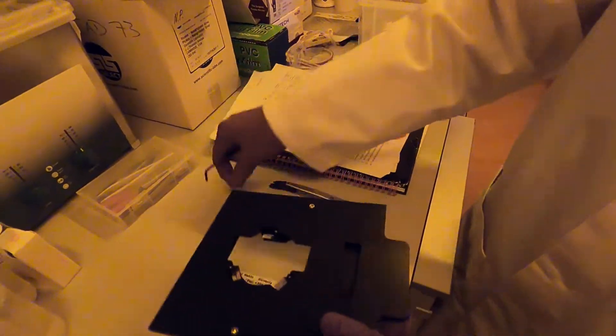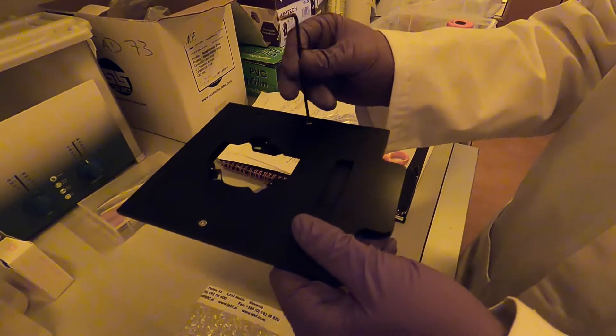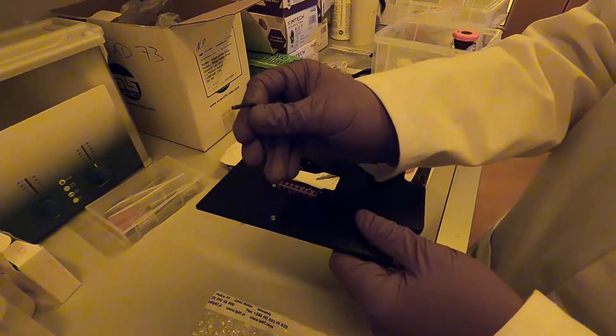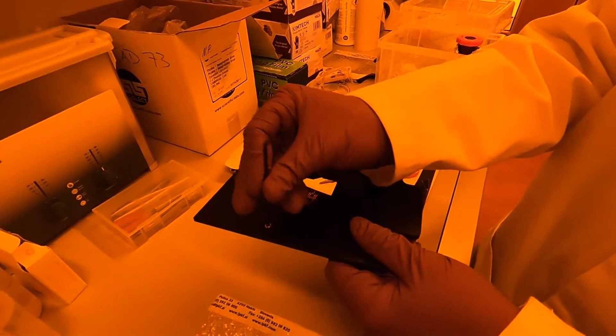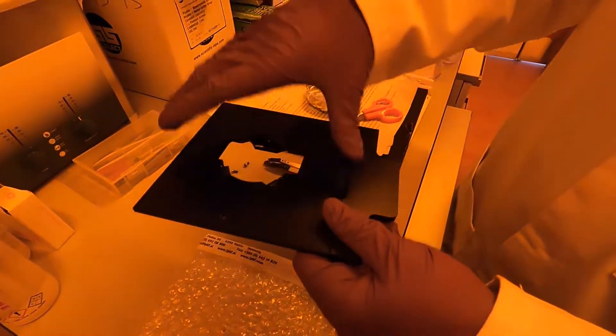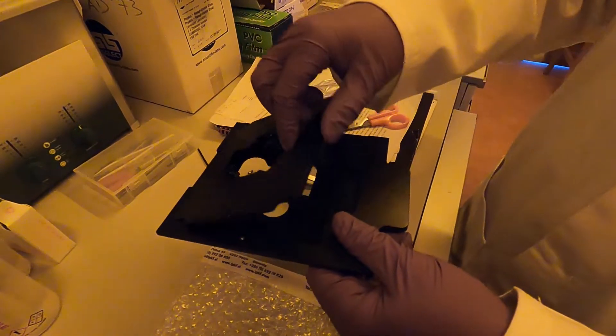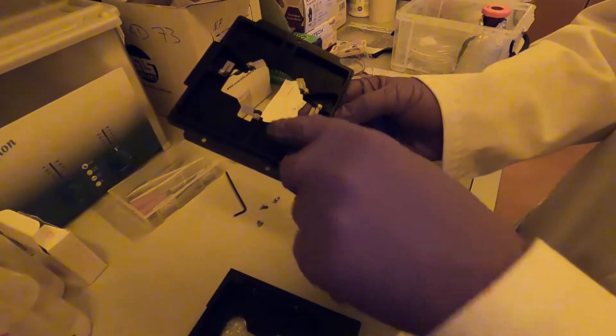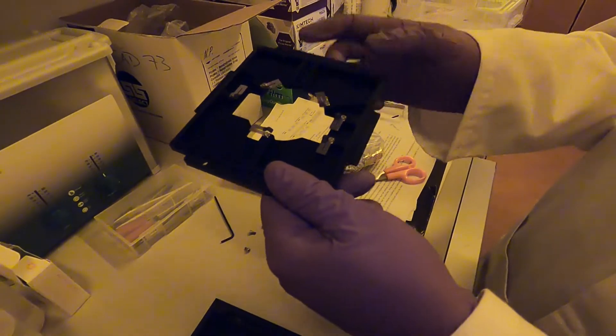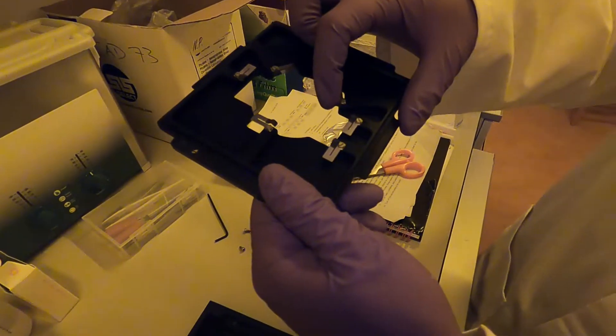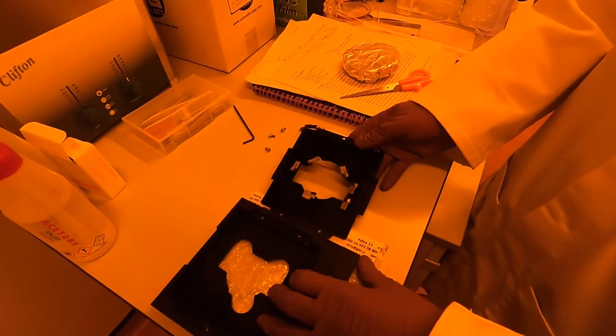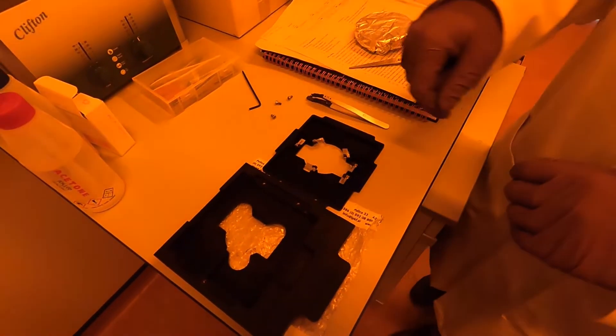You want to undo these three screws and now you're ready to lift up the top plate. As you lift it up just be careful not to stick your fingers on these little clips. What is actually holding the sample in place inside the holder are these little spring clips, so you see that they are quite fragile. You don't want to stick your finger and possibly break one of these. The screws themselves actually don't hold the sample, it's the spring clips that hold the sample in place.